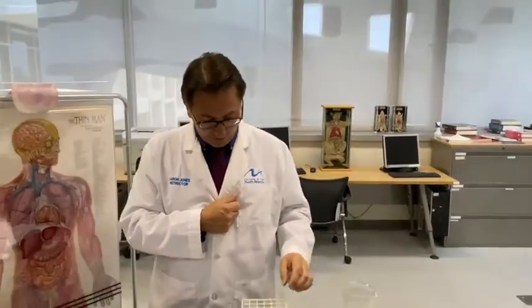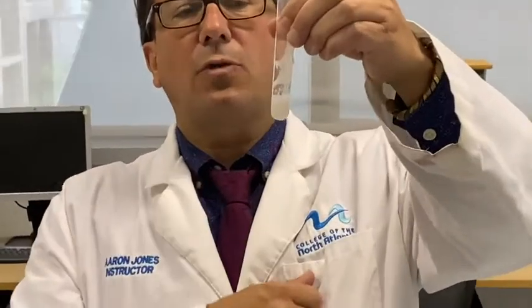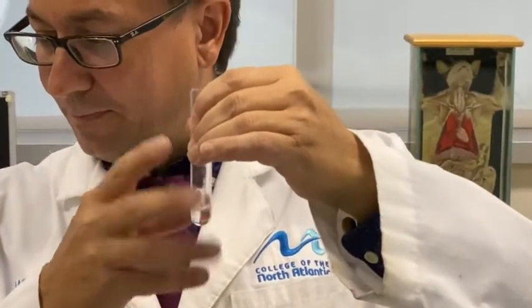In 6, starch and amylase forms a cloudy solution. Now, for 7 and 8, I started with amylase, which is a cloudy solution. I've heated them in the water bath for 3 minutes, and it gives us a clear solution now. It's not cloudy anymore. So it starts slightly cloudy and turns clear.